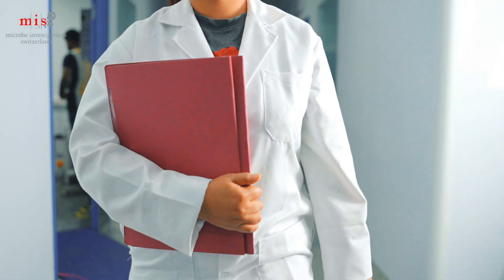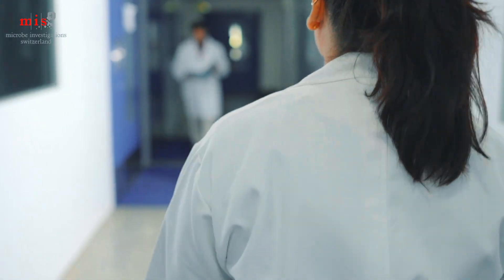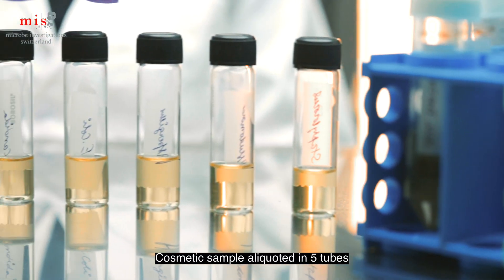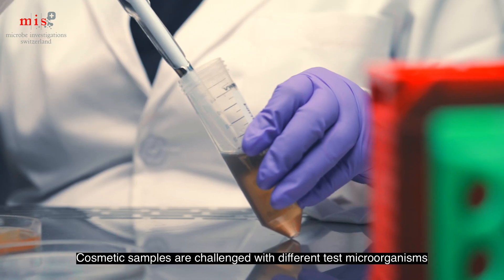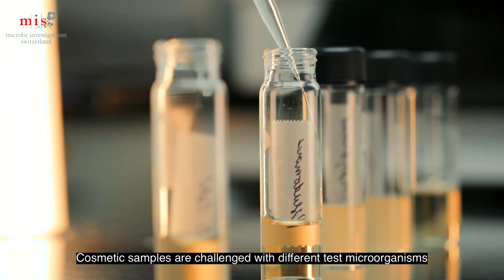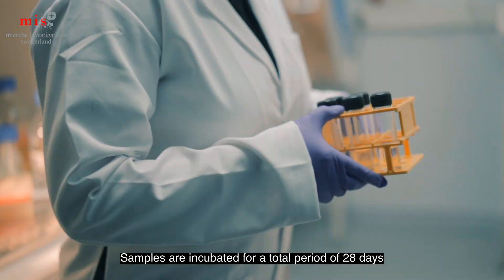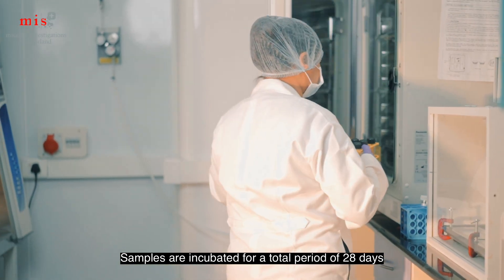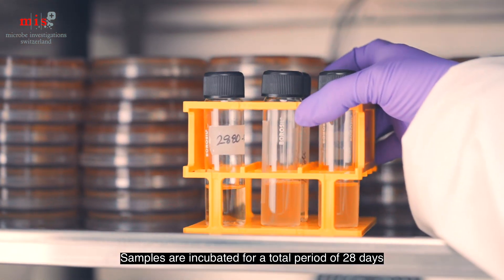ISO 11930 is performed to evaluate the preservative efficacy of cosmetic products. The test begins with inoculation of the cosmetic product sample with mandatory test microorganisms. Inoculated samples are then kept at room temperature in an incubator for a total time period of 28 days.